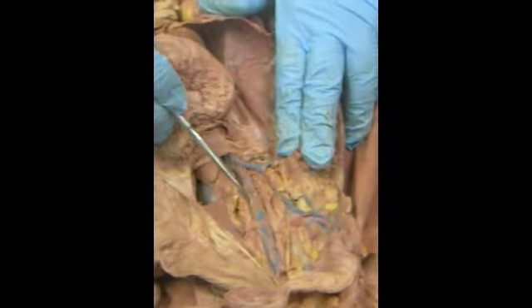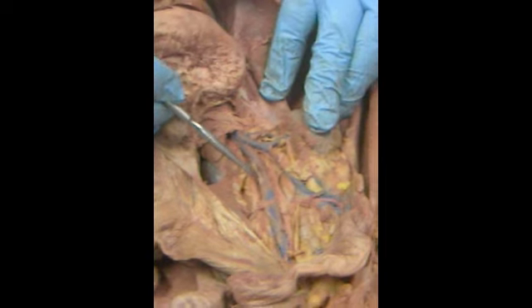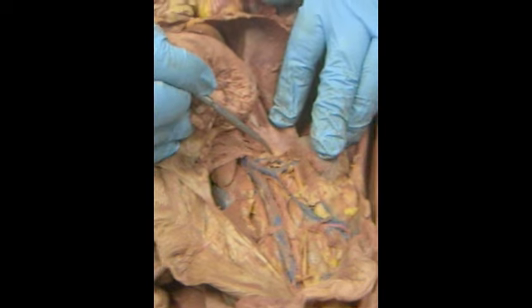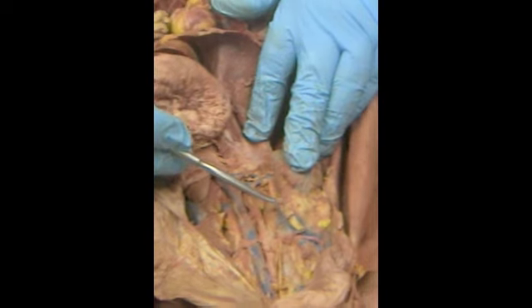Now, if we do blood vessels, we're down here. We're down below the diaphragm, so we're in the abdominal pelvic. The major blue vessel is the inferior vena cava. We have the renal going to the kidney, the adrenal going above it. This would be the right renal over here. This is the genital coming off the renal.